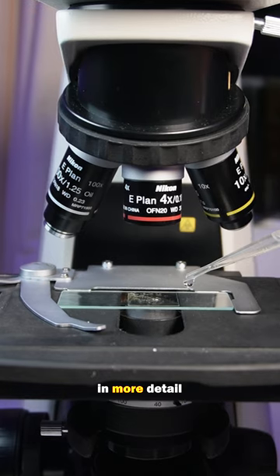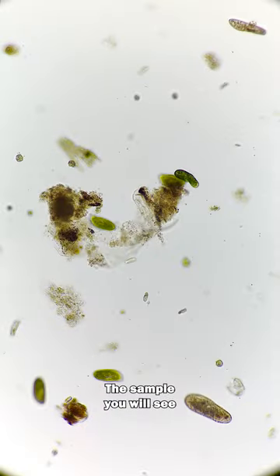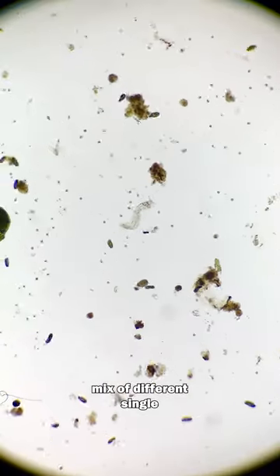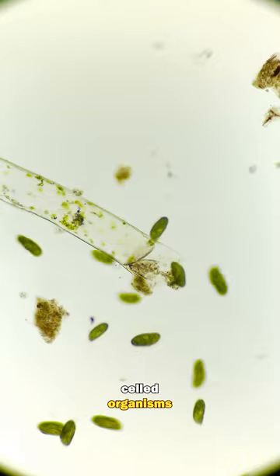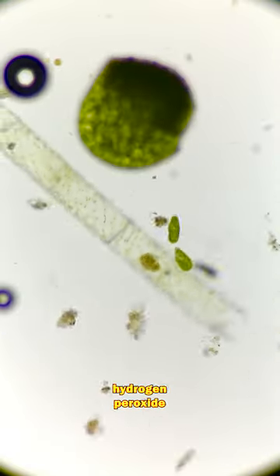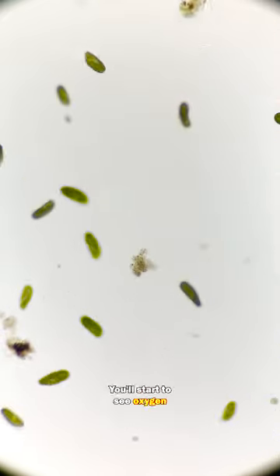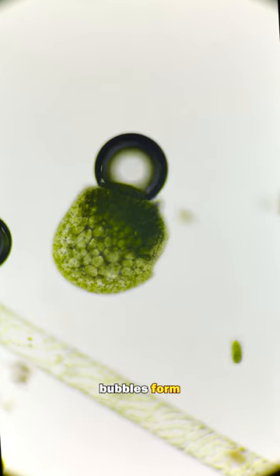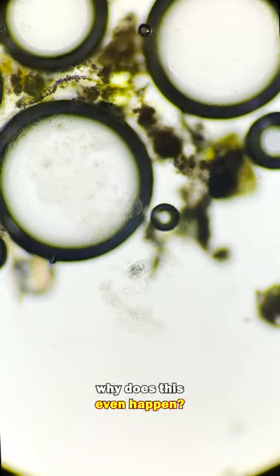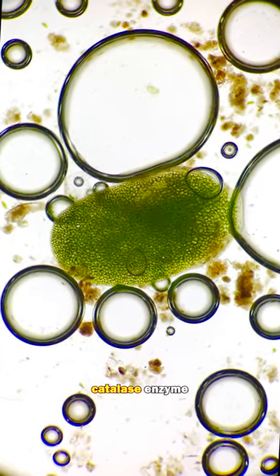Let's watch this in more detail under the microscope. The sample you will see here is a complex mix of different single-celled organisms, and to this sample I've added hydrogen peroxide. As the solution passes through, you'll start to see oxygen bubbles form. How and why does this even happen? Many organisms have a catalase enzyme.